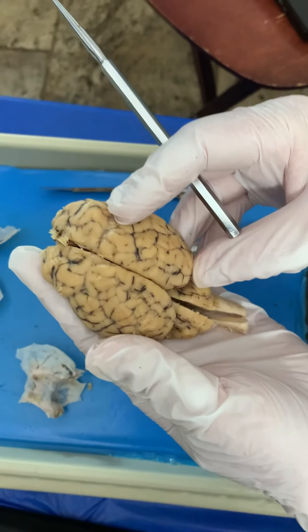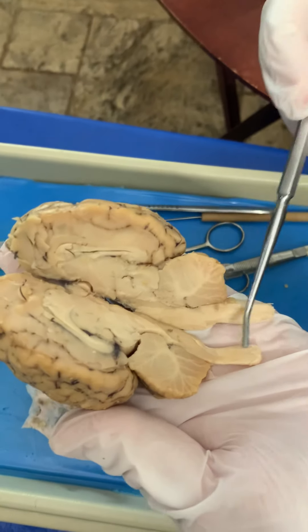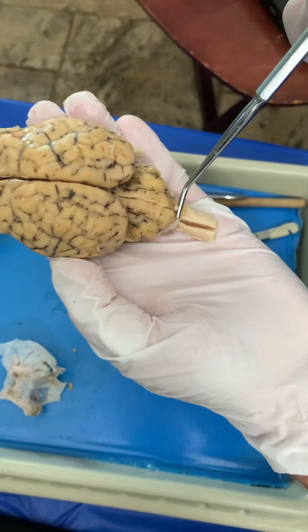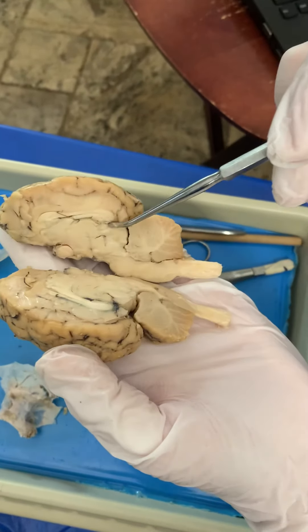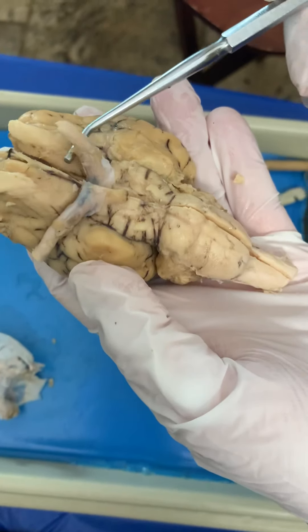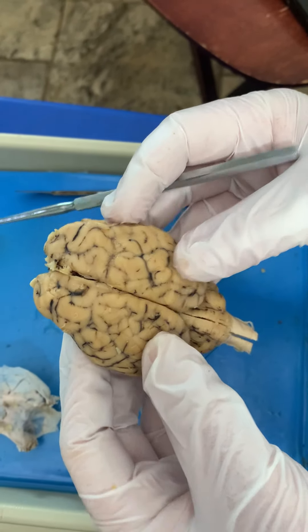So this is the brain. If we put it back together, this is what it looks like: here are your different lobes — frontal, parietal, occipital, temporal. Open it up and you have your cerebellum, your spinal cord connecting all the way down the vertebral column, the vermis of the cerebellum, and all these structures inside — the corpus callosum, superior and inferior colliculi, the pineal gland, the pituitary gland — and think about those optic nerves connecting to your eyeballs. This is the dissection of the brain we would have been doing if we were in class.